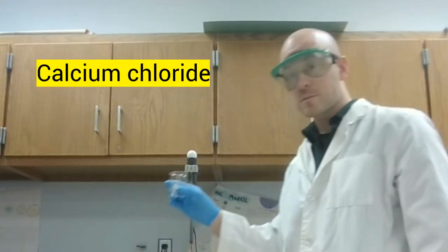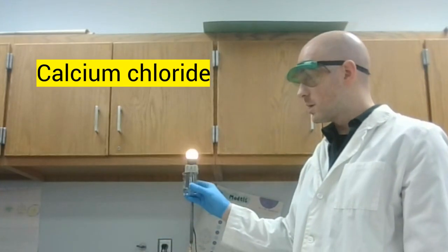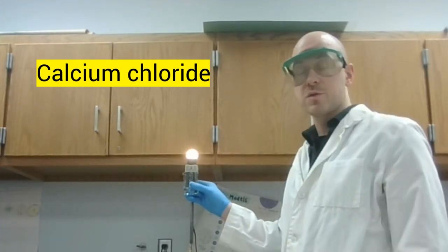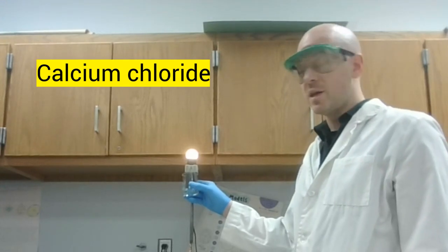Calcium chloride, once dissolved in water, indeed lights up the light bulb. Now this is exceptionally bright. I don't know if you can tell on your screen. This has a high conductivity.